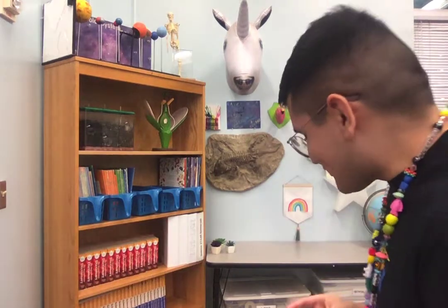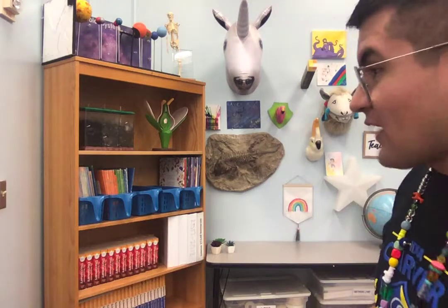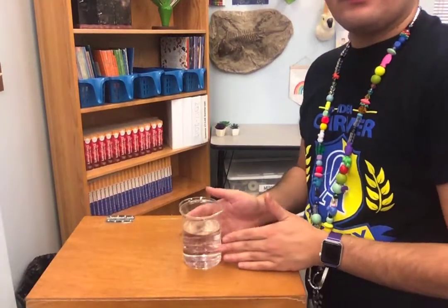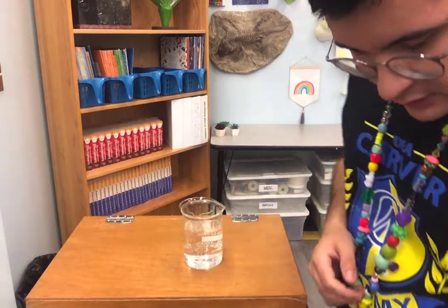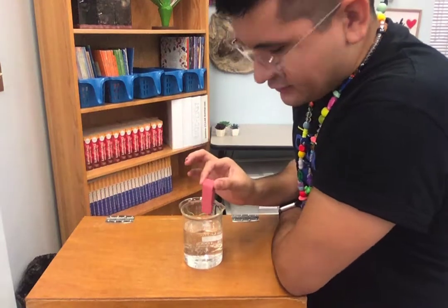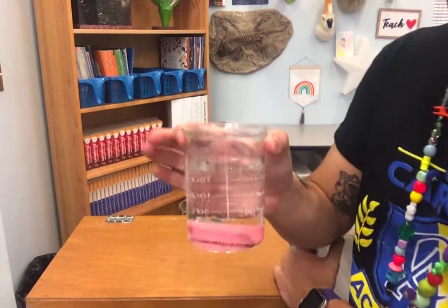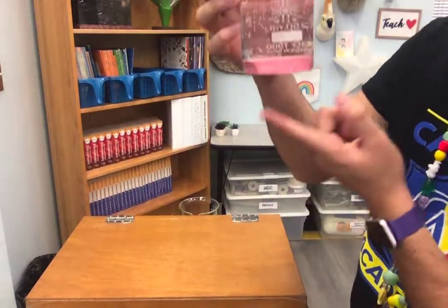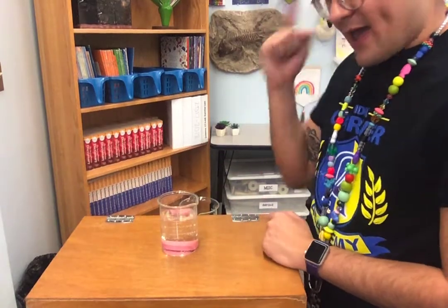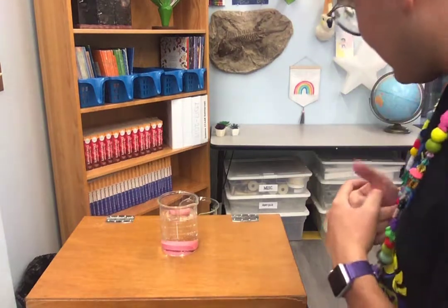The following six materials, and see if they're either more dense or less dense. And it's going to be up to you to classify them. So here is my beaker filled with some water. And we're just going to test them. Starting off with our handy dandy rubber eraser, we're just going to drop it in there and see what happens. Ready? 1, 2, 3. Where did it go? I observe that the eraser has sunk. So classify it. Is it either more dense or less dense? Go ahead and take note of that in your table.